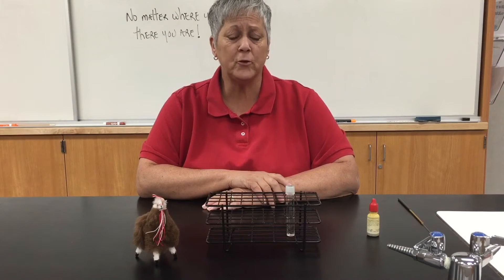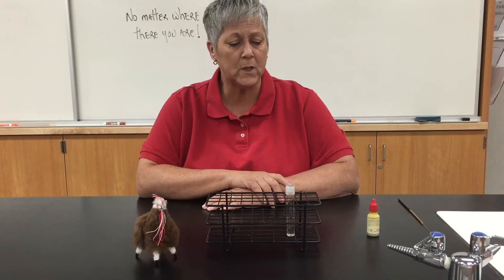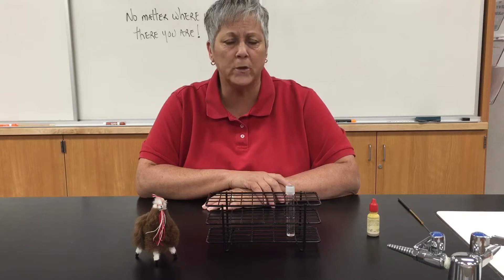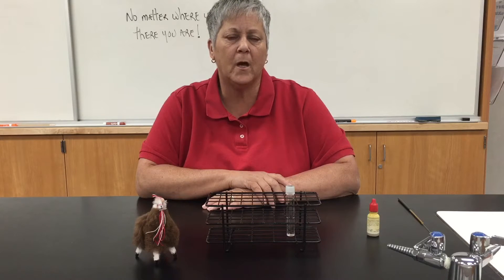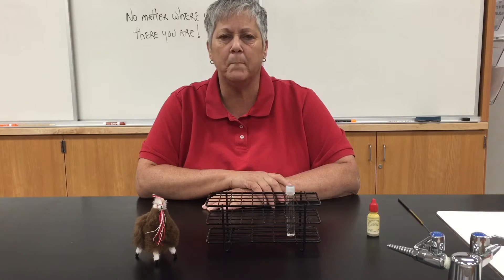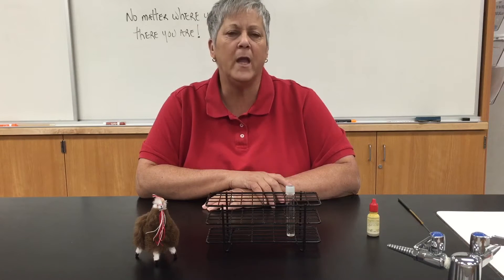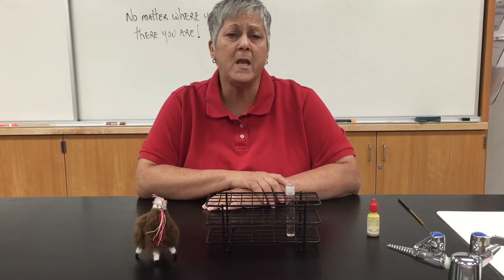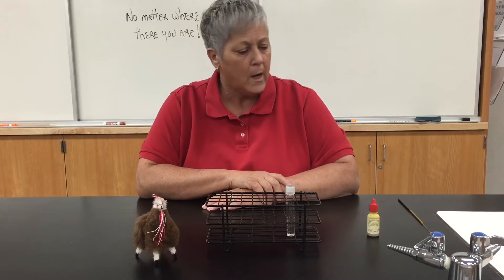Hi students, Professor Schimmel back with a brief discussion of the Indole test. We are looking at the ability of microorganisms to ferment an amino acid called tryptophan. If they are able to do this, the main end product produced is called Indole.